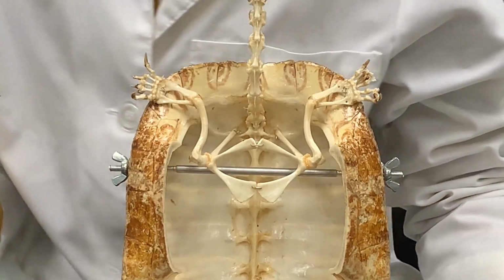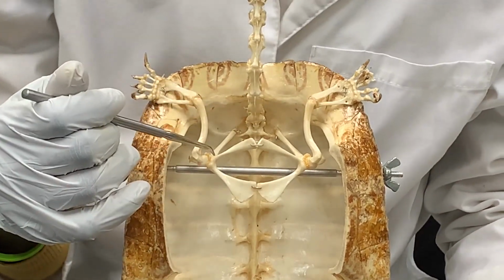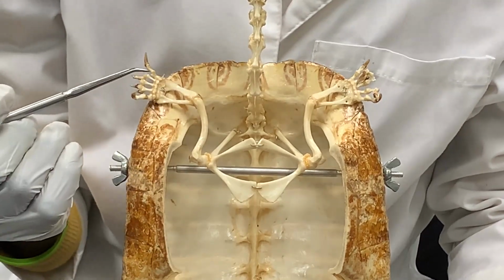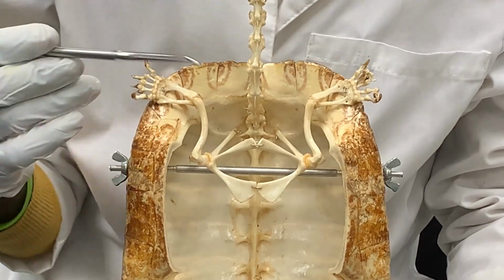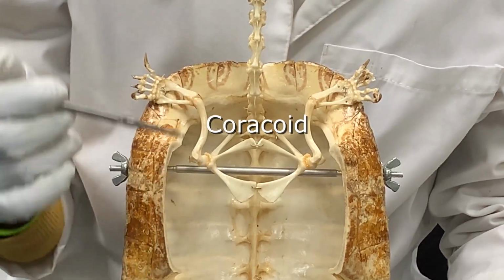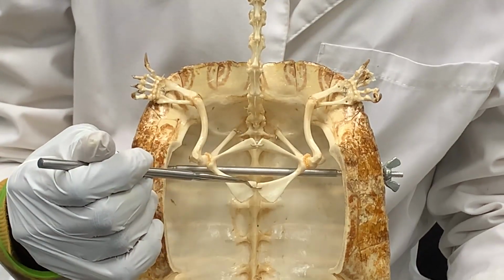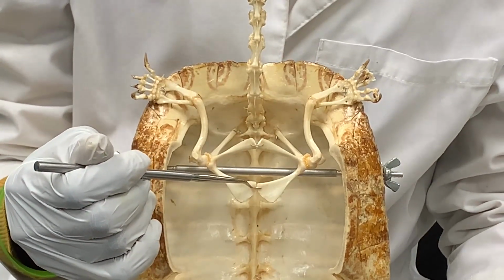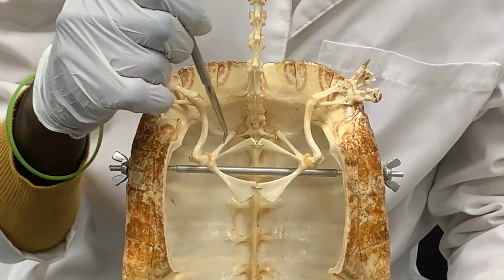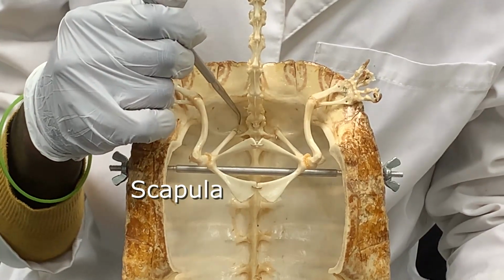The pectoral girdle is found around the thoracic area of the turtle, and it's made up of two bones. We have the coracoid here, and it usually extends medially towards the plastron. Then on the side, we have the scapula, which extends towards the carapace.